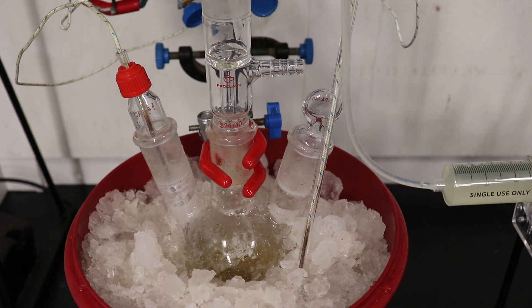Looking at the tube dripping out the sodium nitrite solution, it seems that the drop rate is quite constant, but then a stream of about 4-5 drops falls out. This could be remedied by fitting a syringe onto the end of the tube. However, I did not do that during this experiment, but the results turned out fine regardless.